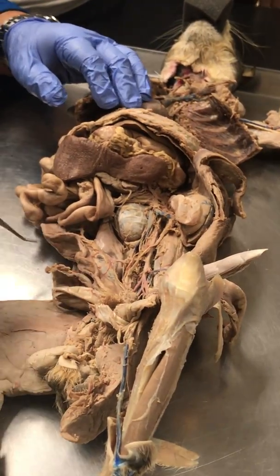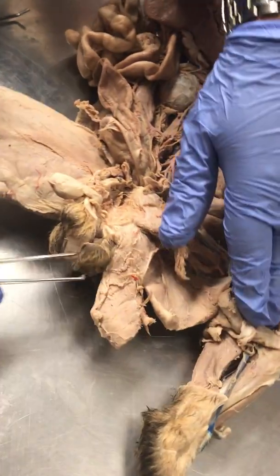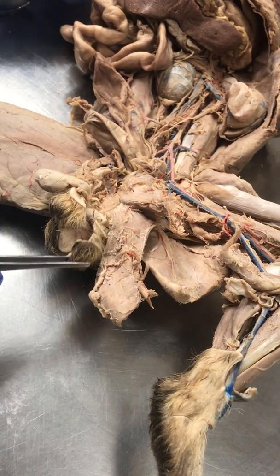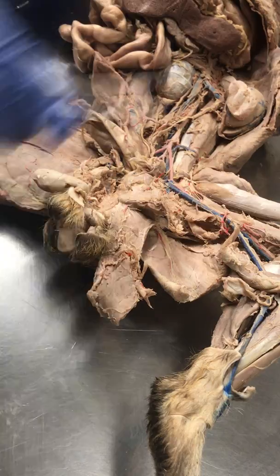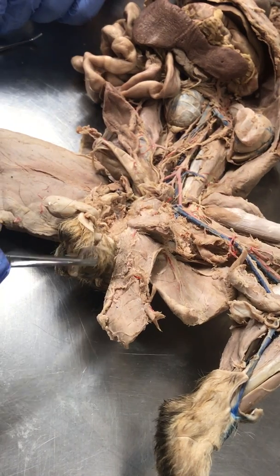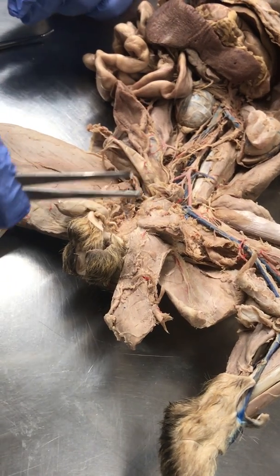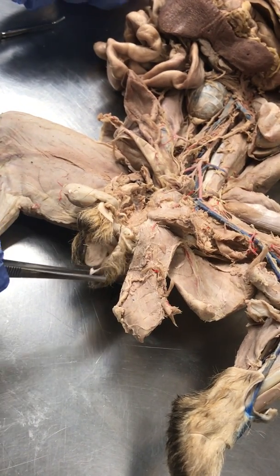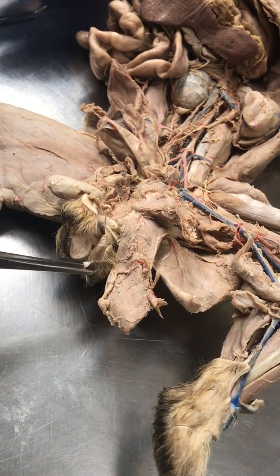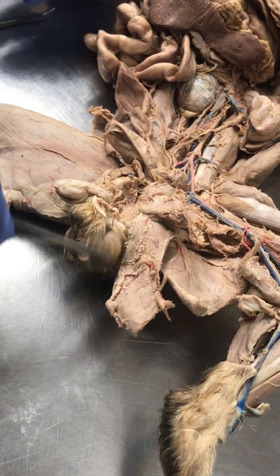Now, is this male or female? Male. It's a male cat. So for a male cat, this part, this sac, is the scrotum. Note that the scrotum has layers, and these layers are homologous to layers found here, right? The outermost layer of the scrotum, right? Well, besides the skin, underneath that would be the dartos tunic, right? Underneath the dartos tunic would be the external spermatic fascia. Then we have the cremaster muscle, then the internal spermatic fascia, and then the tunica vaginalis, all the way back, all the way to the testes, right?